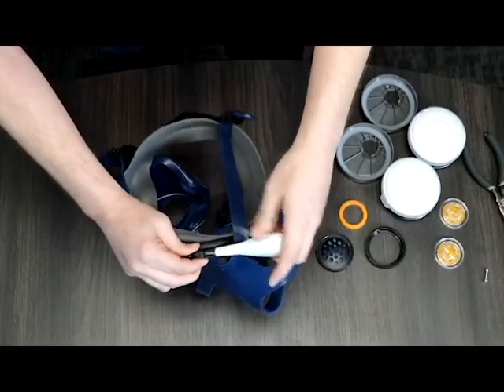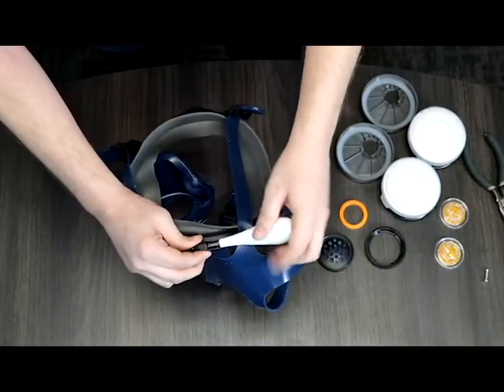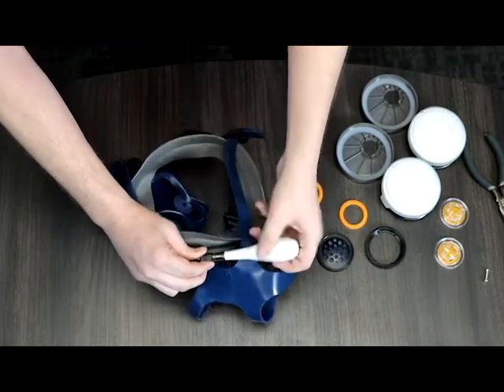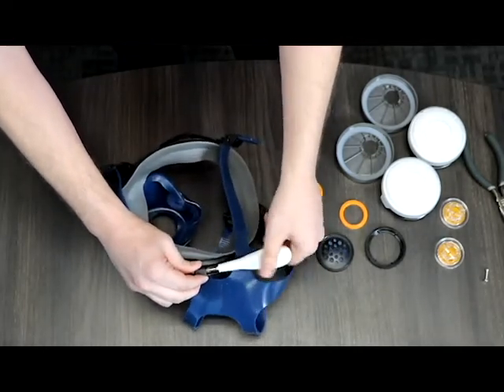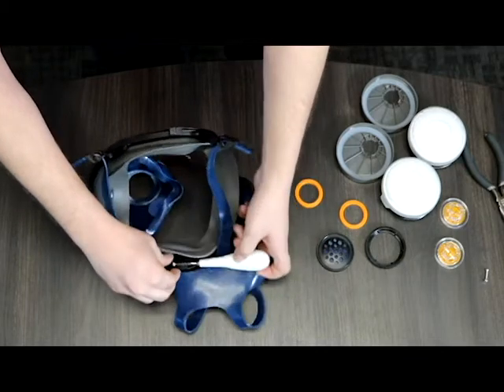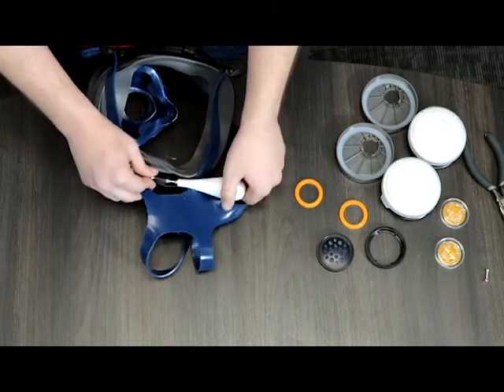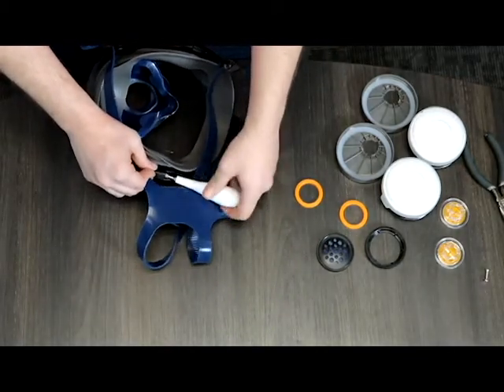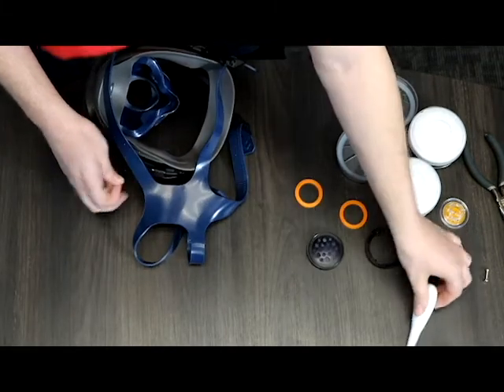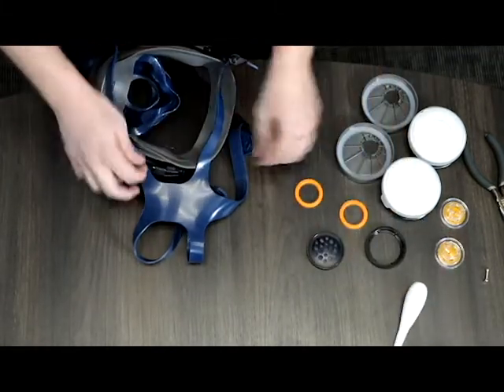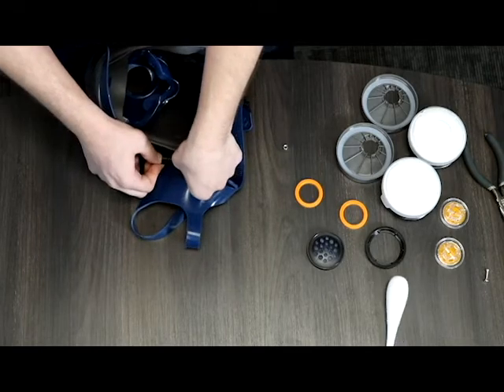Then we move on to the other side. We're going to remove the second screw there, sorry a bolt. There is a nut and bolt on both sides of the mask. I put them back together and put them off to the side.